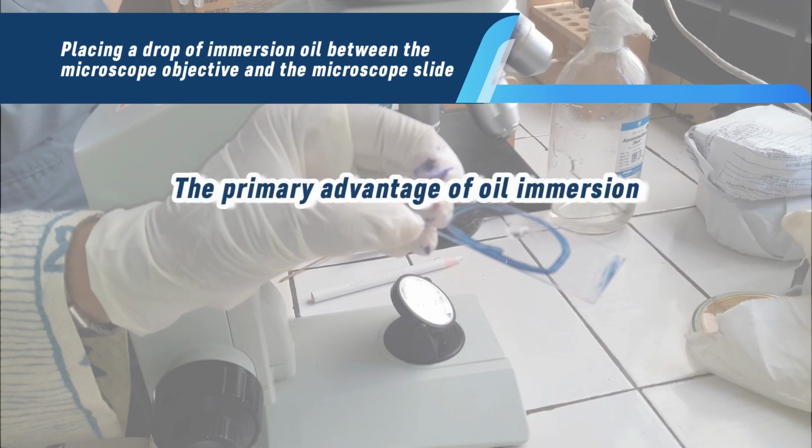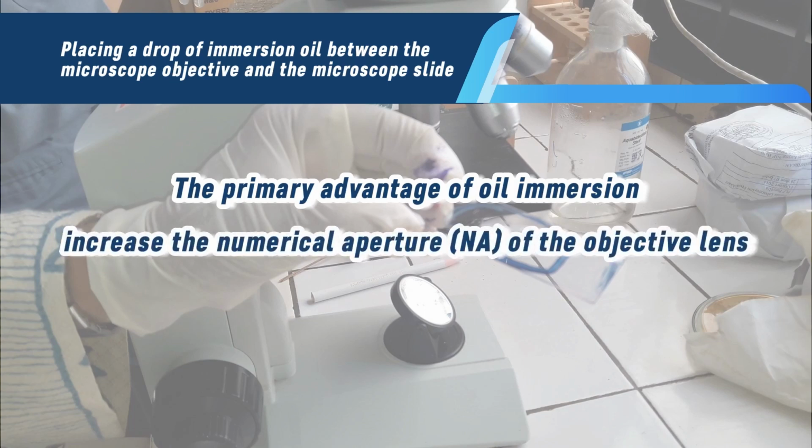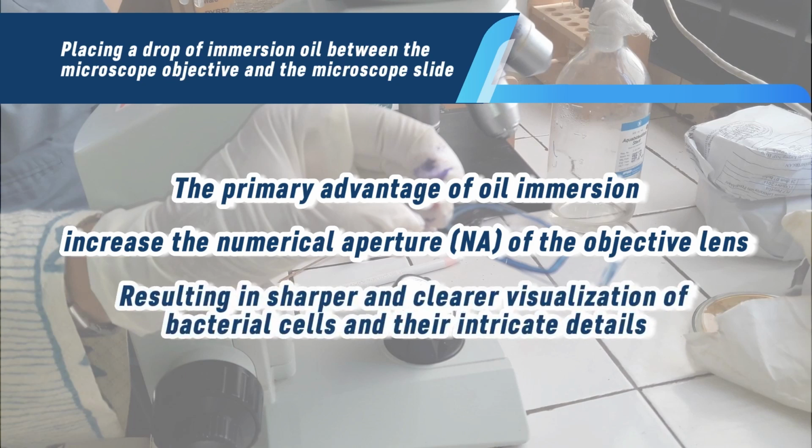The primary advantage of oil immersion is its ability to increase the numerical aperture, NA, of the objective lens, which determines the resolving power of the microscope. Higher numerical aperture allows for better resolution, enabling the observation of smaller details within bacterial cells. Without oil immersion, the quality of the image may degrade due to refractive index mismatch between the glass slide, the specimen, and the objective lens, whereas oil immersion results in sharper and clearer visualization of bacterial cells and their intricate details.